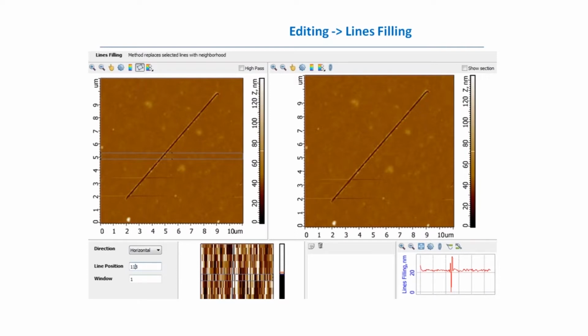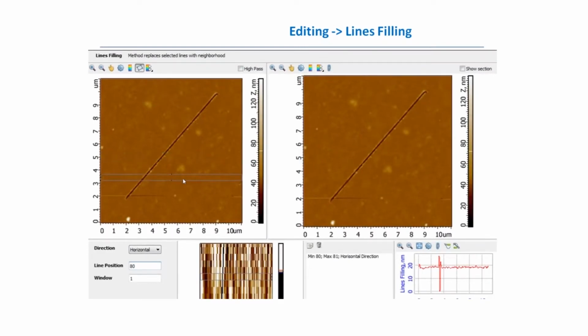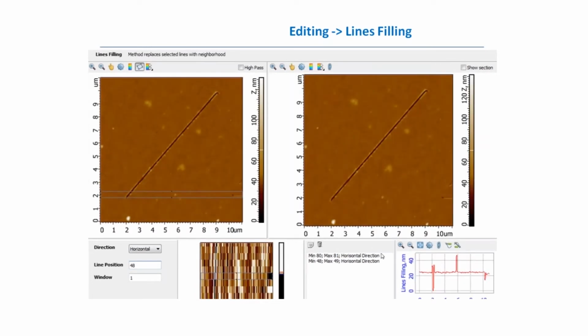Here from the bottom you can see the zoom of this window, and when you see the spike, you will see it. When we come to this line spike, the algorithm just removes this line using the neighborhood. Applying this, you can press Ctrl Enter or press this button, and this line will be remembered, and you go to the next line and remove it. So finally you get two lines removed and a clear nice image.